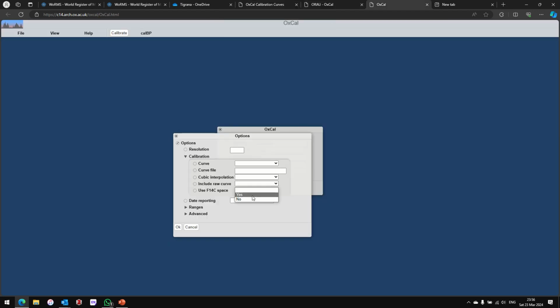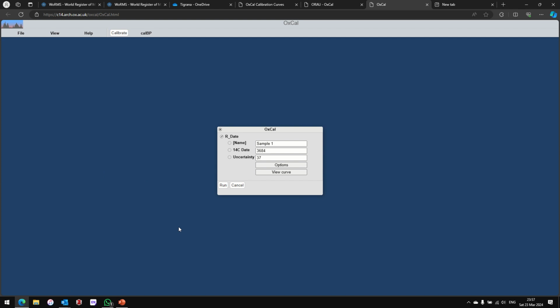And I'll include raw curve, yes. A cubic interpolation, I really have no idea what that is. Date reporting, I want that to be in cal BP instead of common era. Parameters. And so I'll go for that. And curve, I'll probably select IntCal20. That seems to be the best fit, because as I said, the marine curves don't seem well suited for my samples. Mine are terrestrial gastropods. So select OK, and I'll go for a run.